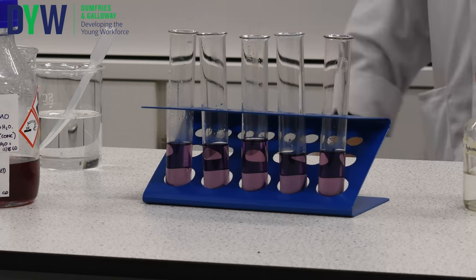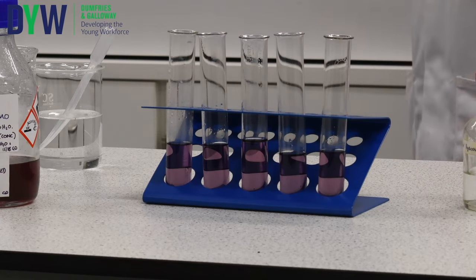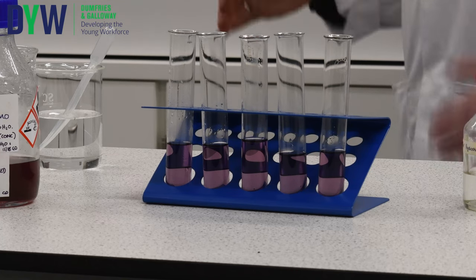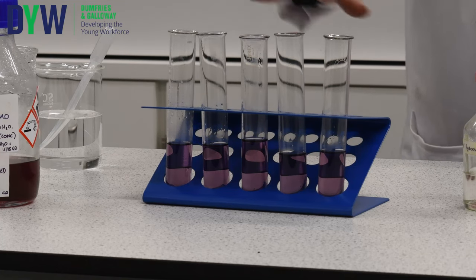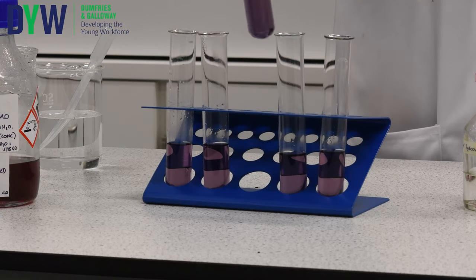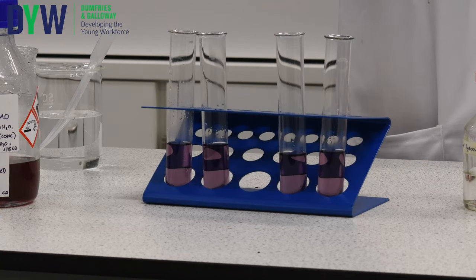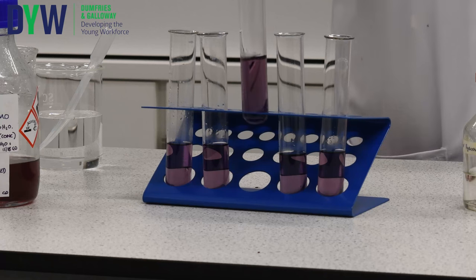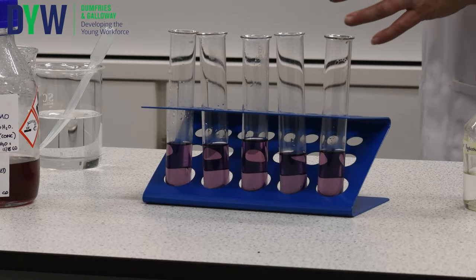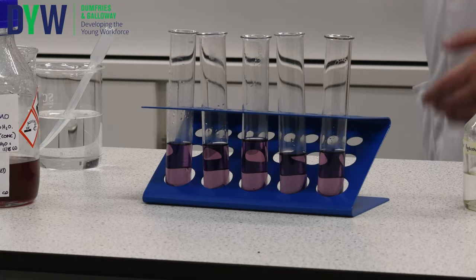We're going to use one today that involves cobalt species. One of the cobalt species is pink and one is blue. These five test tubes are sitting at the equilibrium point at the moment, and you can see the colour is somewhere in between pink and blue.